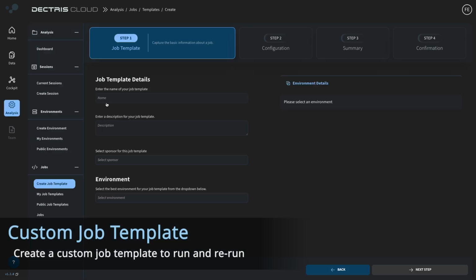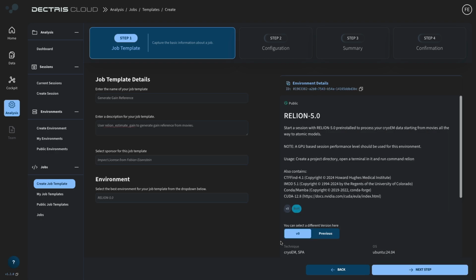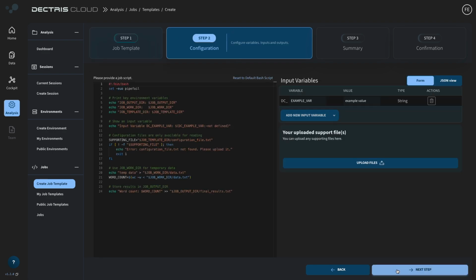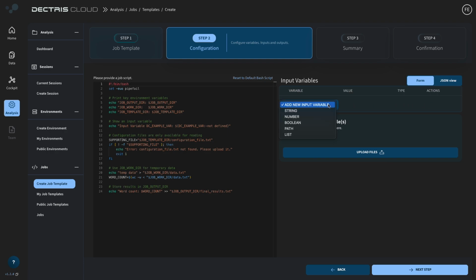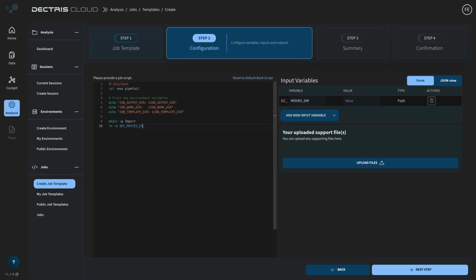So to calculate the gain reference on the fly, let's make a job template. Choosing the Relion environment with all the Relion tools already pre-installed, we can simply access the Relion commands. And the job is basically just a bash file that has access to environment variables that the user can give as input variables. So let's remove all this and let's add a quick import job for Relion, and then we can run relion_estimate_gain.